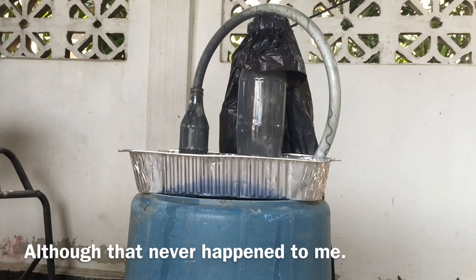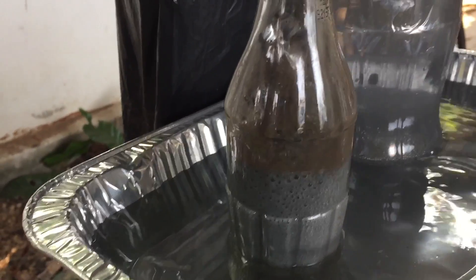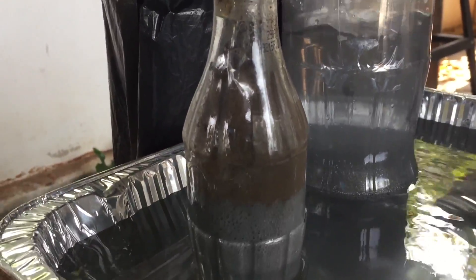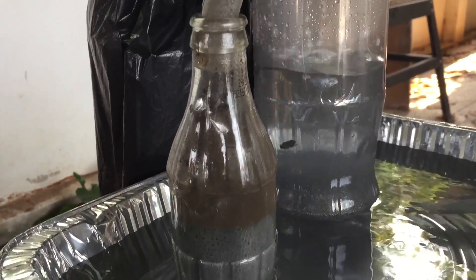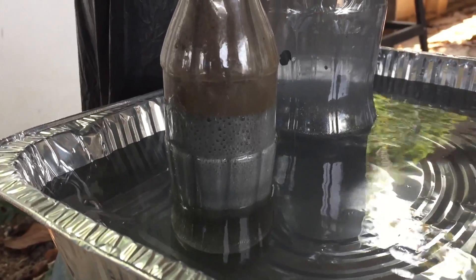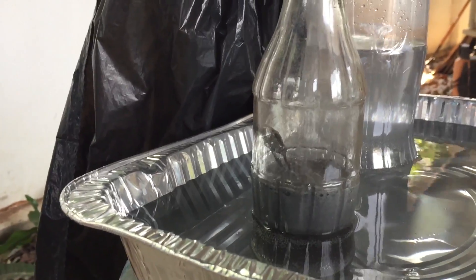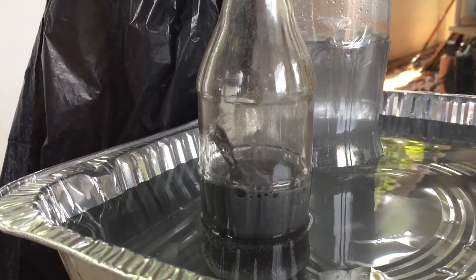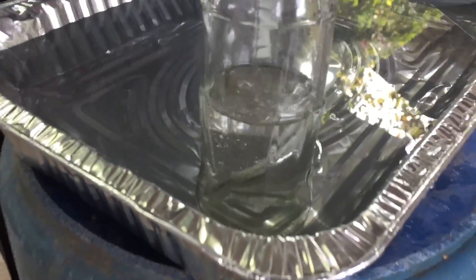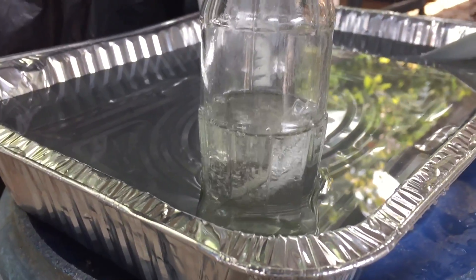I was so scared bringing my hands near it, but everything was fine. Eventually the reaction slowed down, but there are flakes of aluminum in the bubbler. Be careful — only fill the bubbler about half full. Keep adding aluminum until the acid stops foaming, then you can switch out a batch of hydrochloric acid and start again.